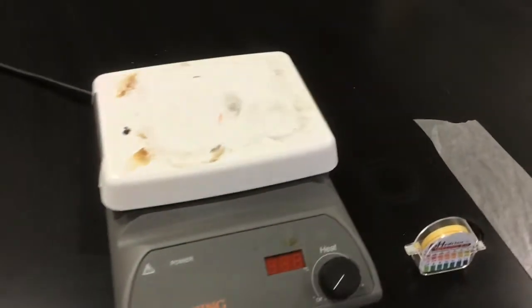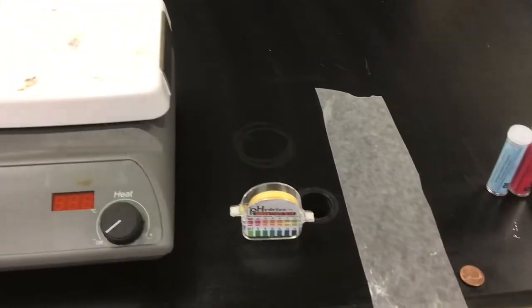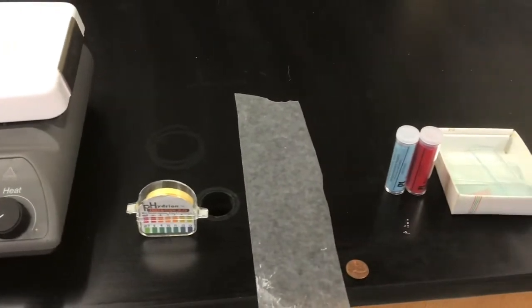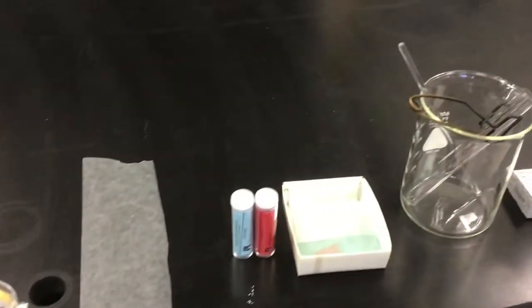These are the supplies you can use for the water on Zork testing. Pay close attention to the pH paper and the litmus paper.